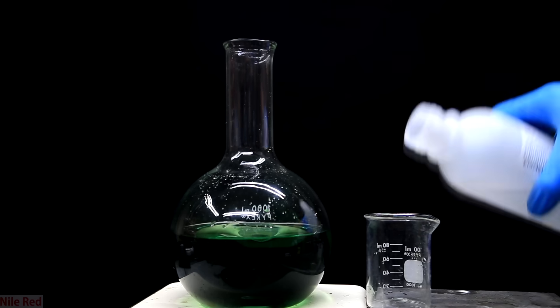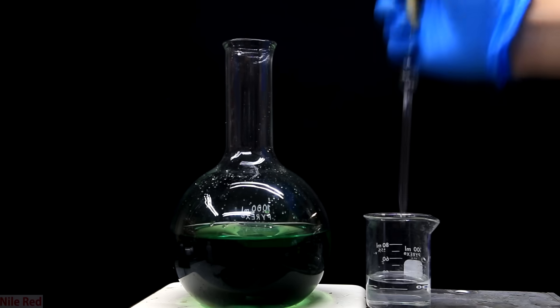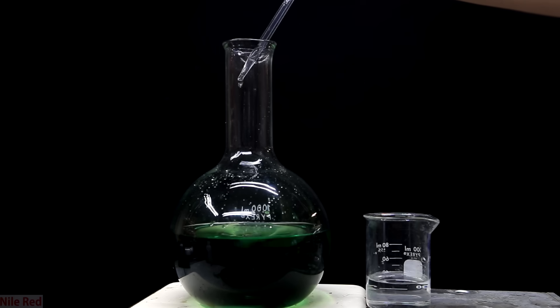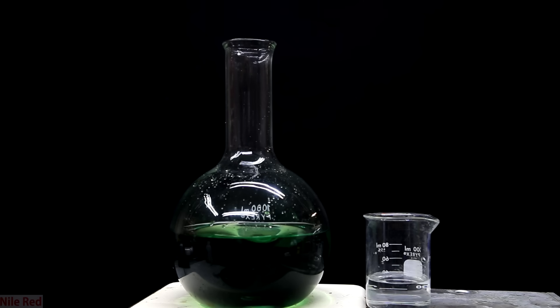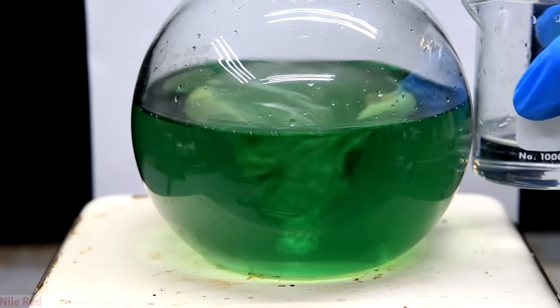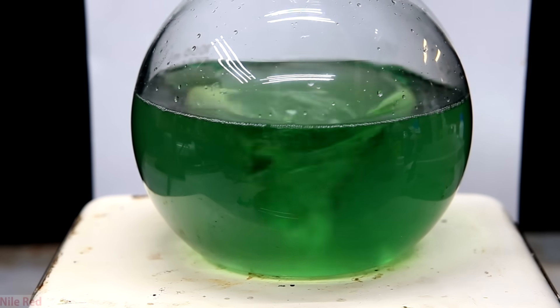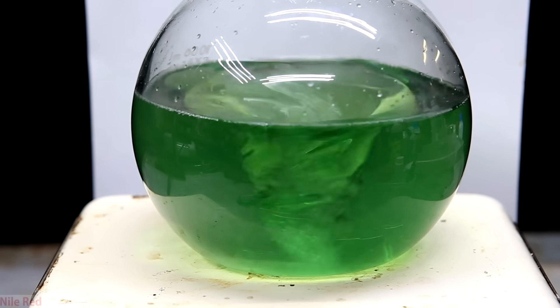Using a magnetic stir bar, we stir the drain cleaner and I add some hydrogen peroxide to a beaker. I started out by adding the peroxide to the sulfuric acid dropwise, but it proved to be too slow. I was trying to go as slow as possible to limit the amount of water I added, but pouring it in is a good option as well. I keep adding more and more, and with strong stirring, the sulfuric acid starts to clear up. After each addition of the peroxide, we wait a little bit to see if it continues to clear up. The color slowly changes from dark green to yellow and then colorless.